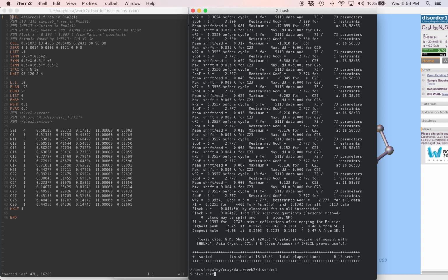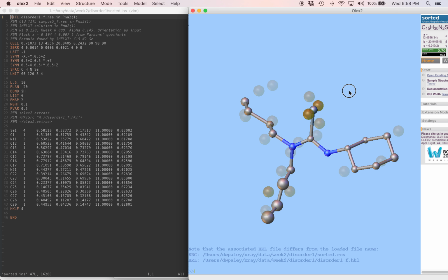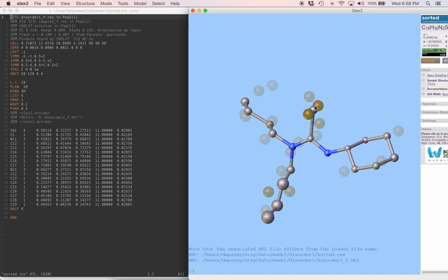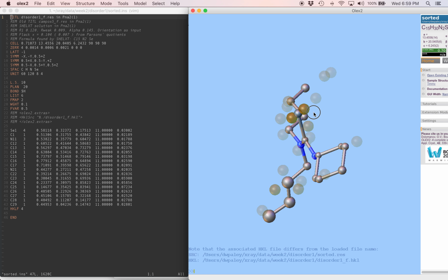See what this looks like. Alright, the molecular geometry was pretty much stable. We can see the biggest difference features are about 6, 7, 8 electrons, and they're very close to the heaviest atom in the structure. That makes a lot of sense. We can see that there's one positive feature on each side of that atom, and we can interpret that as the atom is vibrating anisotropically back and forth, pretty much perpendicular to this carbon-selenium bond.